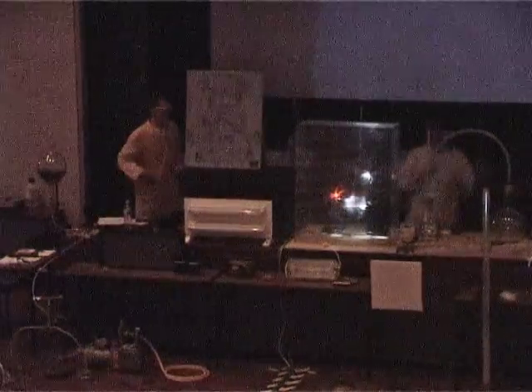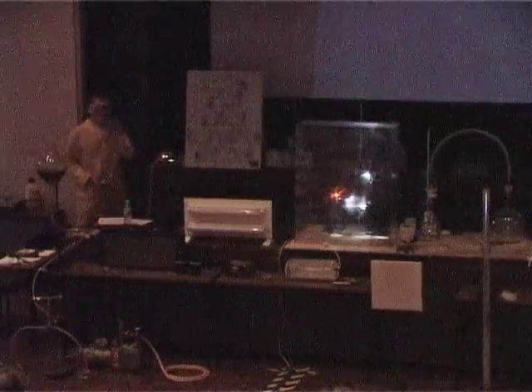So are you ready? First of all, let's try some red light.